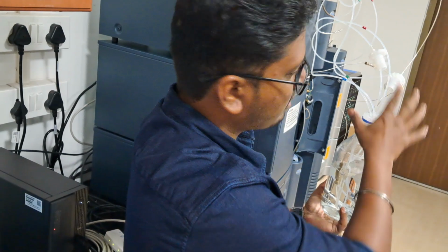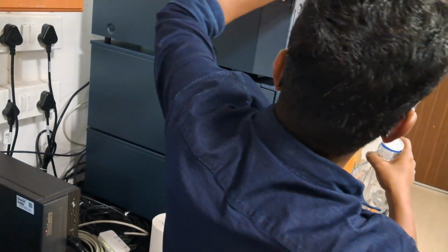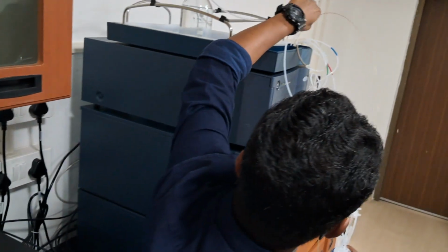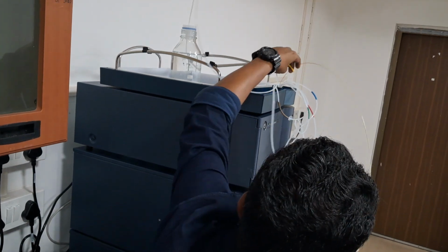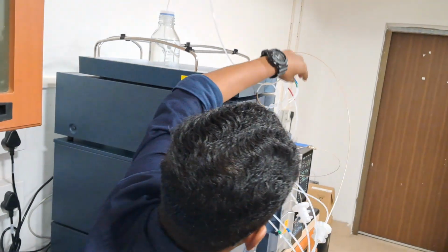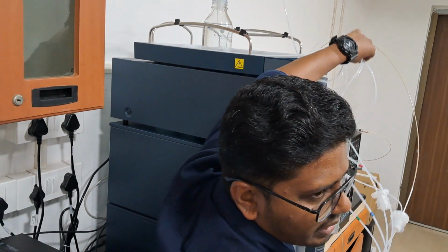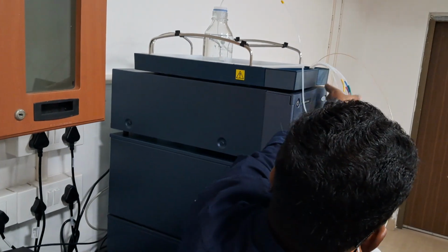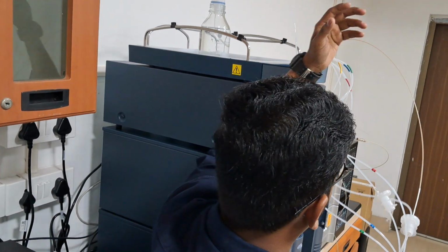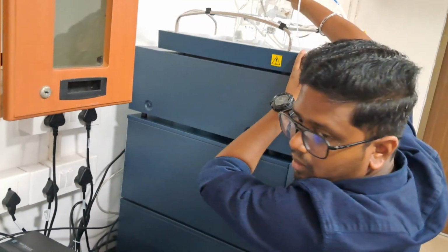The tags are there. If you remove the tags, it will not be easy to identify, but here we have the tagline, and it cannot be removed. You can trace which line you want to use. This is the easiest way. There are also color codes for the lines running through the system, so if it falls down, you can track it easily. The same thing has been written here: A, B, C, D. Okay, I'll just keep it back. Any doubts? That's fine.